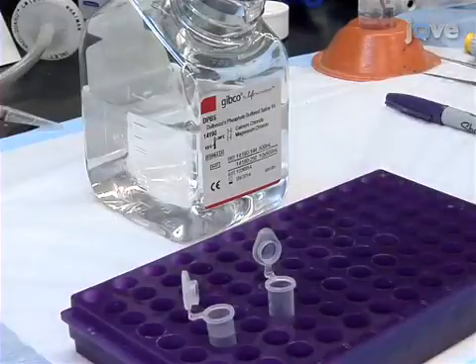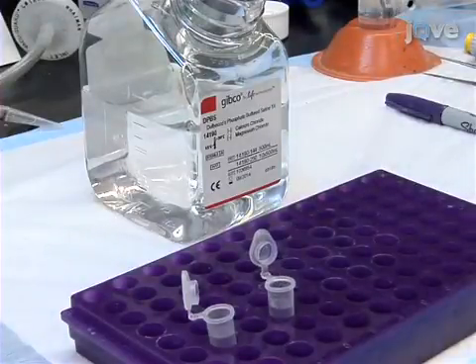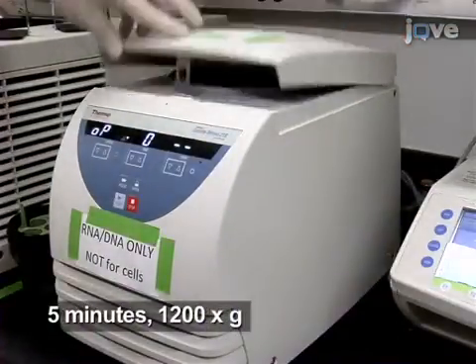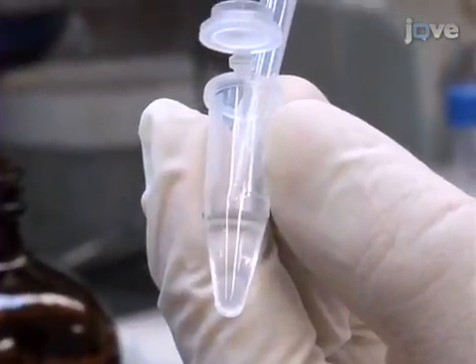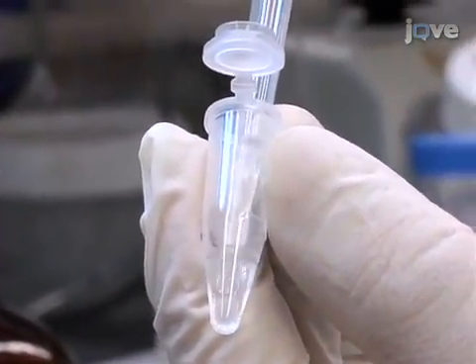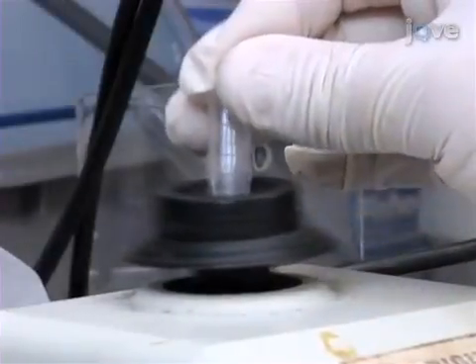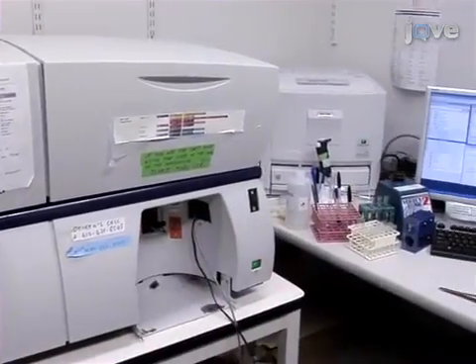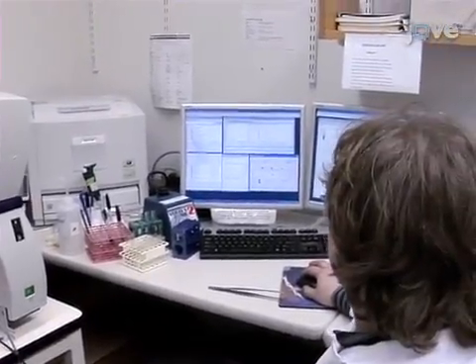After incubation with staining antibodies, add 1 milliliter of FACS buffer to both tubes and spin down the cells in a microcentrifuge for 5 minutes at 1200 times G. Then fix the pellets in 400 microliters of 1% paraformaldehyde in PBS and vortex the tubes to prevent clumping. Finally, analyze the cells by flow cytometry using the negative control cell sample and BD CompBeads.